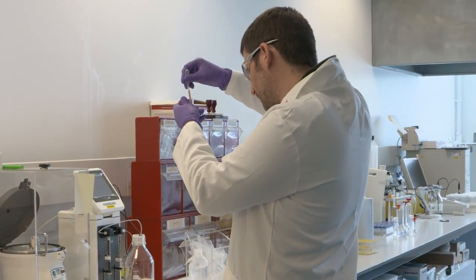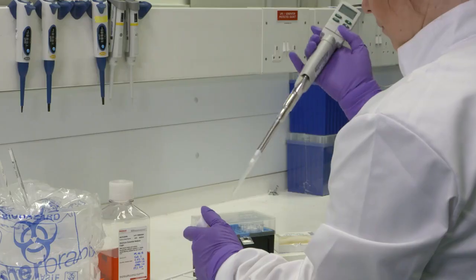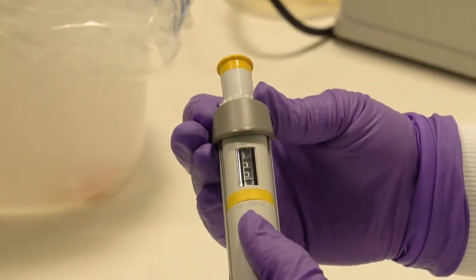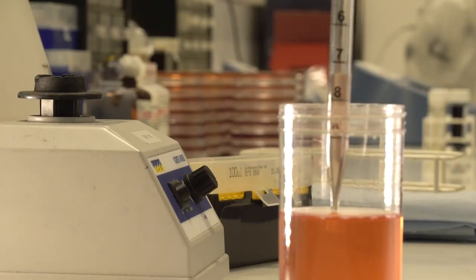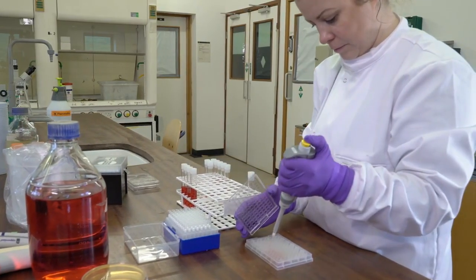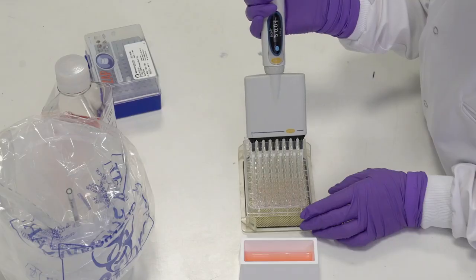Pipettes work by air displacement, and there are various types. Some are manual, others are electronic. Some have their volume control in the pipette itself. Others rely on the pipette tip to indicate the correct volume required. Irrespective of the type of pipette, there are some key operational techniques which will allow you to use them accurately and safely.